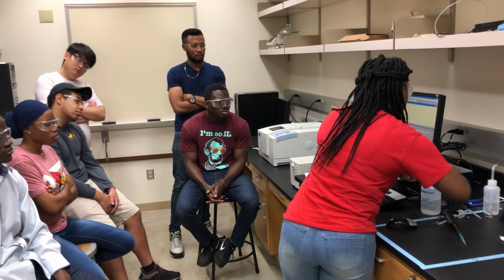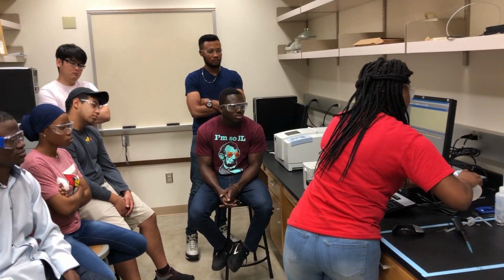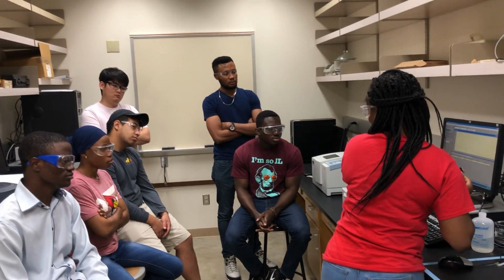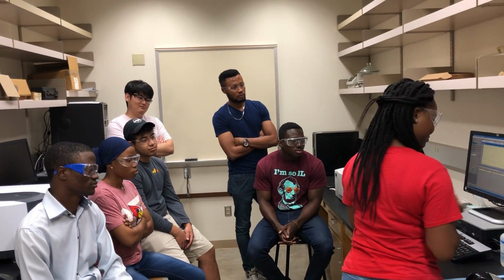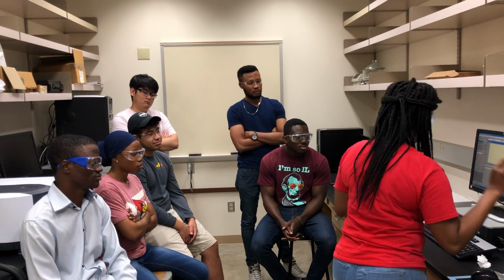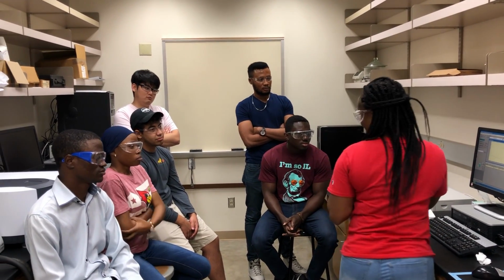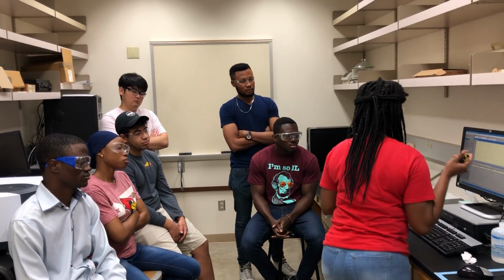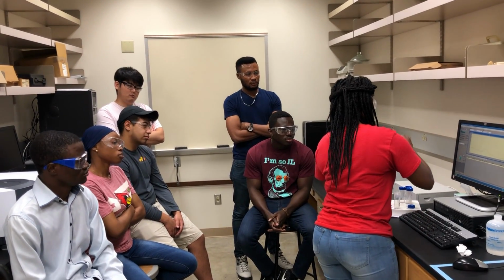You want to look at me, and do the same as you get to your lab bench. And if you have any questions, you ask me. I'm always around to help. Make sure you change your pipette tip. And let's try the second one.